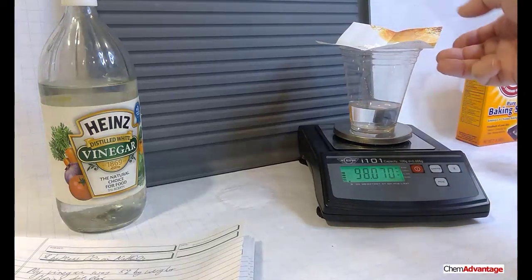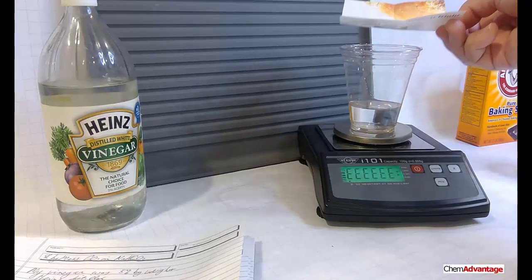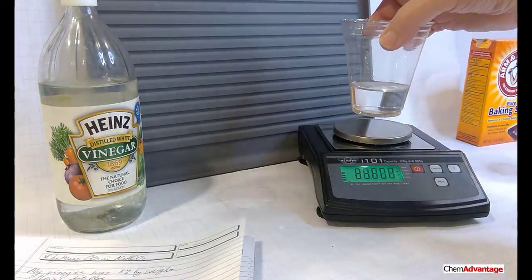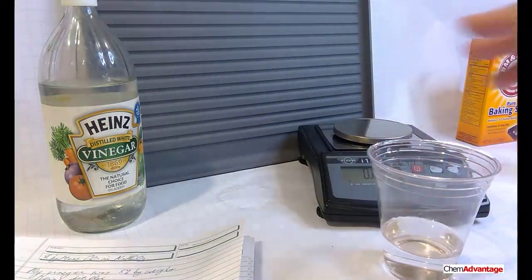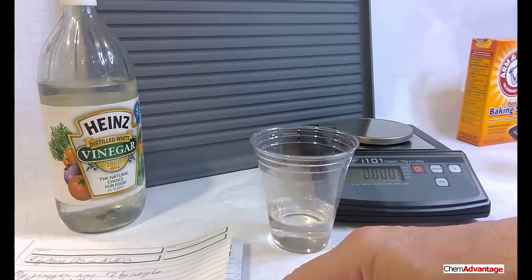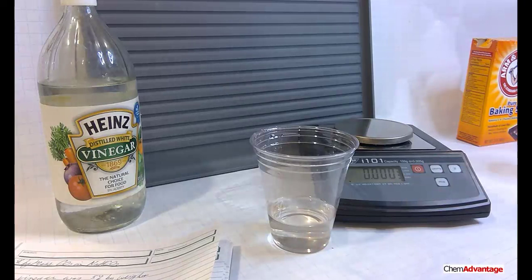So let me get this tared paper away. I'll take my reaction vessel and put it in center stage, right about there, right next to my lab notebook, and I wrote down the amount. Don't forget to write down these amounts, otherwise you have to do the experiment over again. So, okay, 98.07, I've got that. That's one of the nice things about having a table ahead of time. It sort of organizes you.